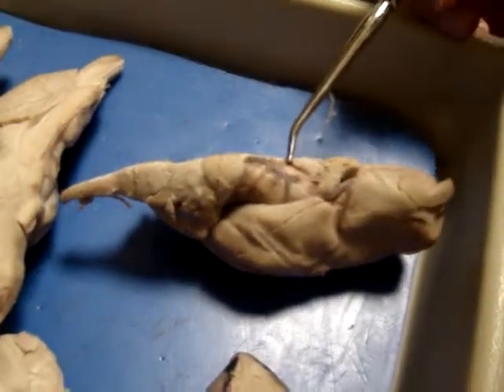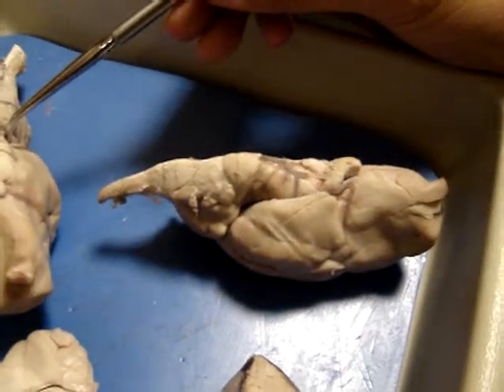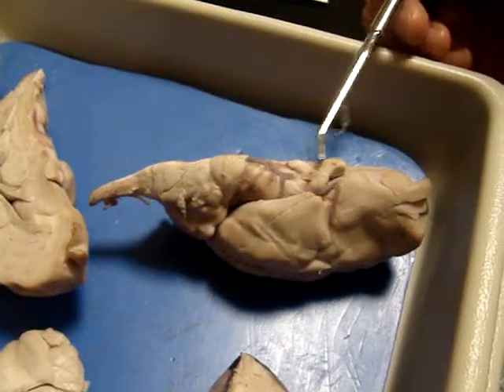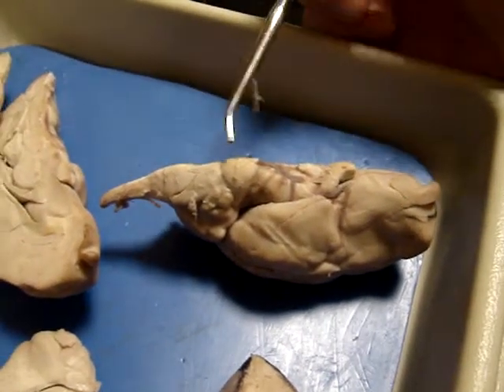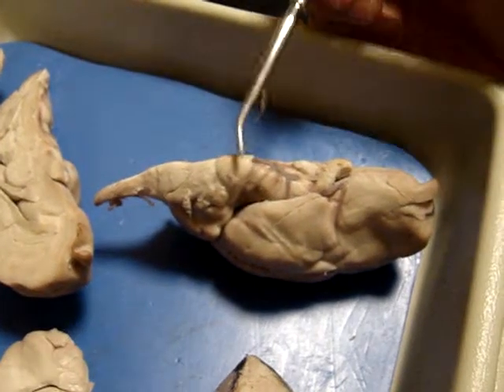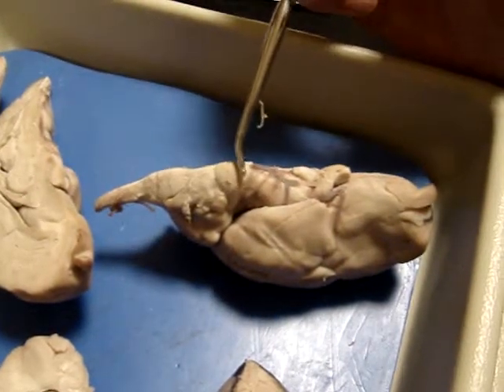Did I miss it? A little piece, it's hard to see in this cut. This one might be a little bit trickier to see, might be using one of the other ones. It's right back behind the optic chiasma. And the mammillary bodies, and then we have here the corpora quadrigemina. The pons, no, pons will be over here on the ventral surface. Yep, so that's all pons.